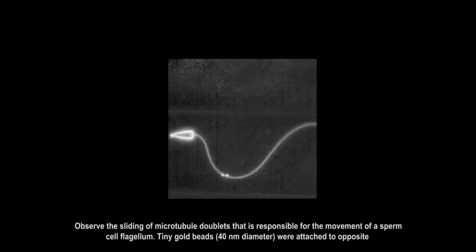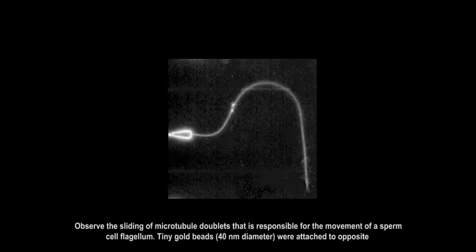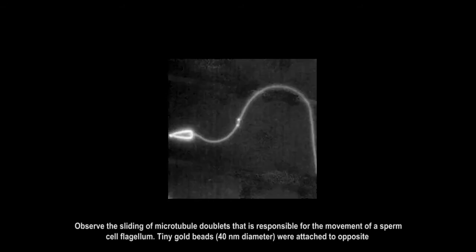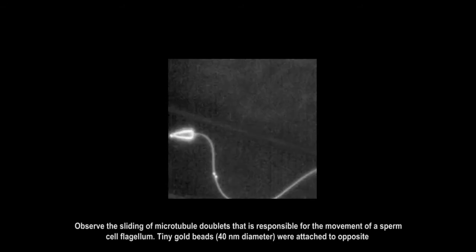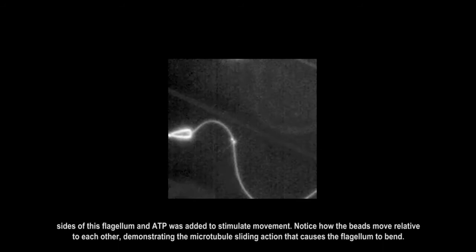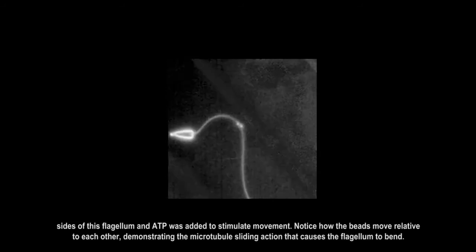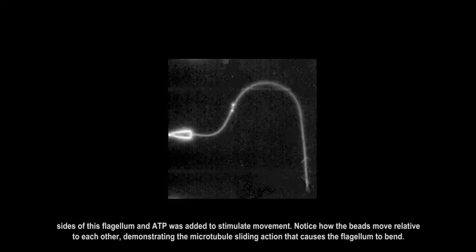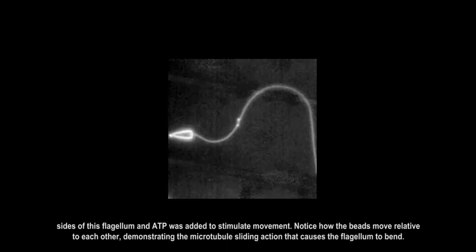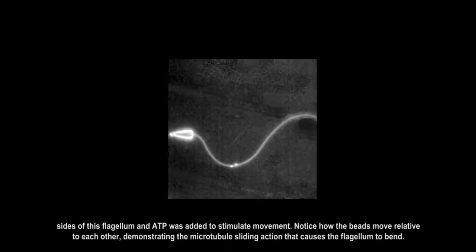Observe the sliding of microtubule doublets that is responsible for the movement of a sperm cell flagellum. Tiny gold beads, 40 nanometers in diameter, were attached to opposite sides of this flagellum and ATP was added to stimulate movement. Notice how the beads move relative to each other, demonstrating the microtubule sliding action that causes the flagellum to bend.